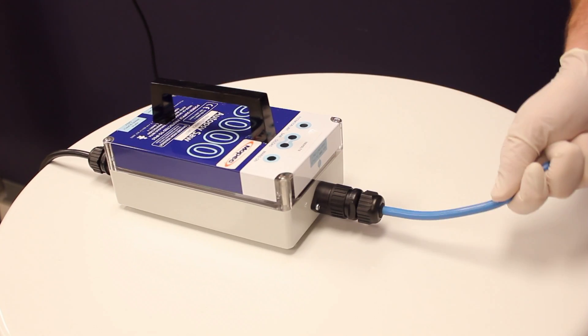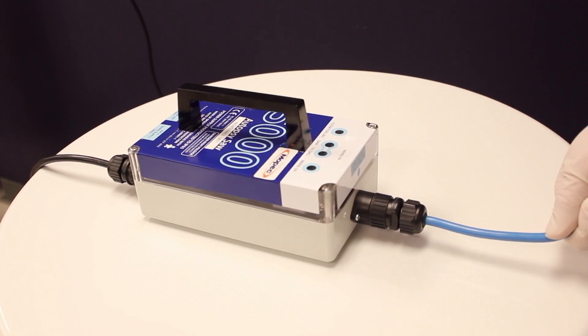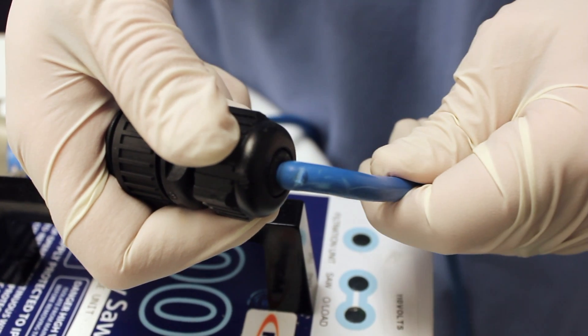Also, remember not to pull or tug the power box by the cord. This can cause the power cable to become frayed or broken.